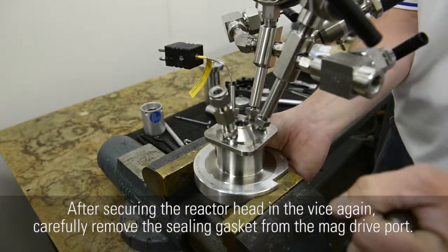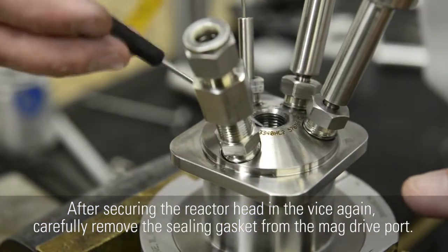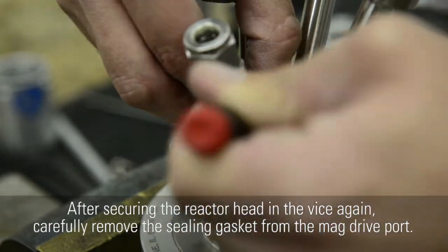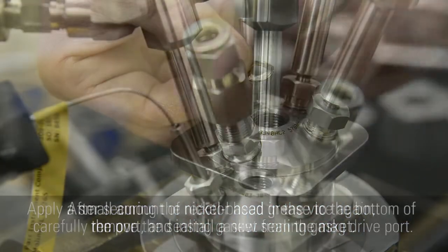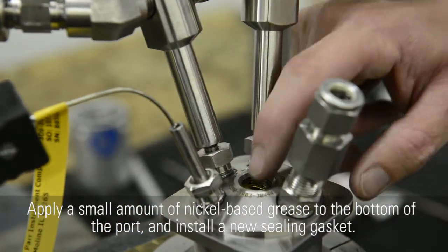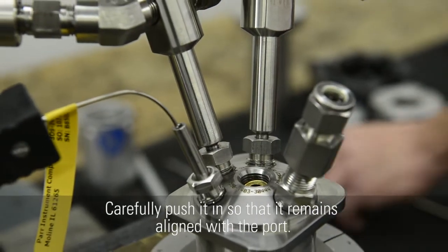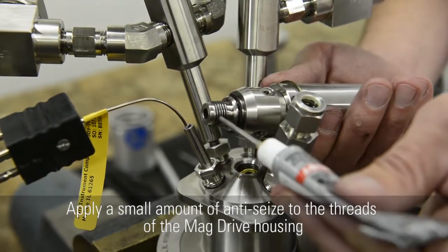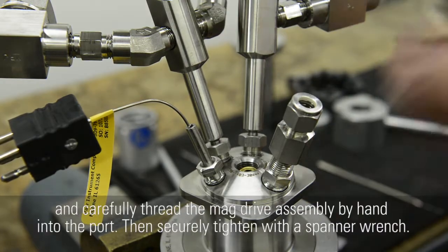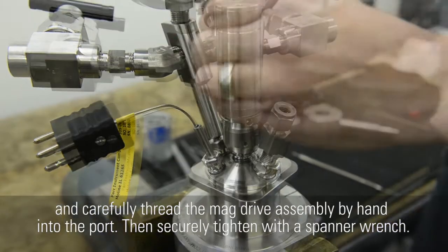After securing the reactor head in the vise again, carefully remove the sealing gasket from the mag drive port. Apply a small amount of nickel-based grease to the bottom of the port and install a new sealing gasket. Carefully push it in so that it remains aligned with the port. Apply a small amount of anti-seize to the threads of the mag drive housing and carefully thread the mag drive assembly by hand into the port. Then securely tighten with a spanner wrench.